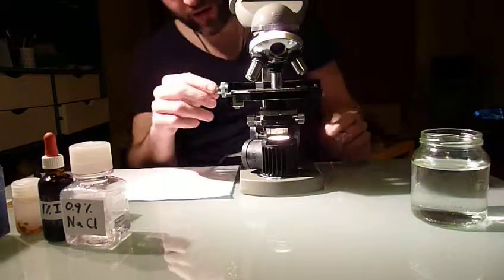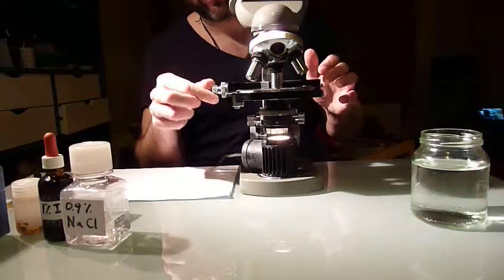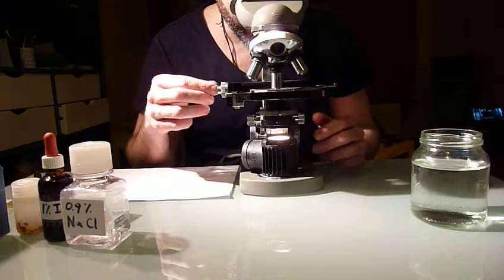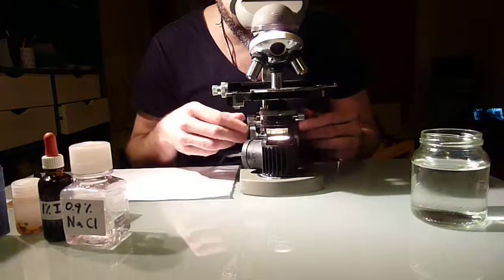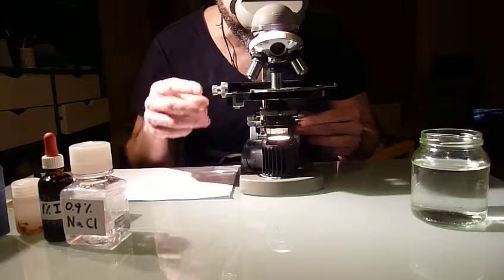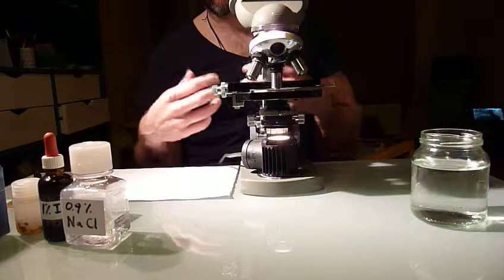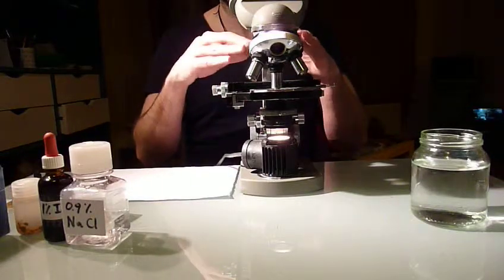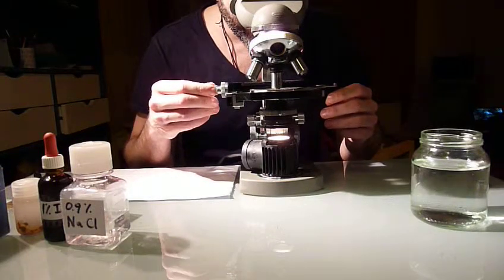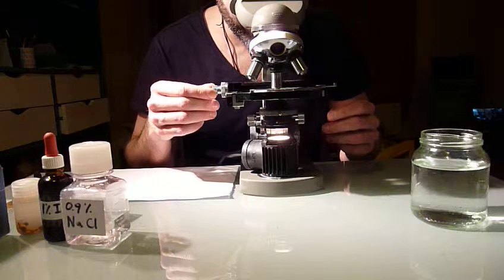so that's fairly easy. If this sample is too thick, then you can move to your more diluted sample. In this case, also here it is definitely more diluted, but still very clear, and actually you can see the morphology and the shape much better in the diluted sample compared to the very thick sample. So this actually looks much nicer.